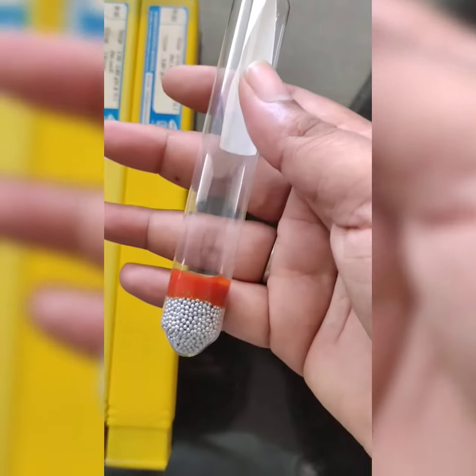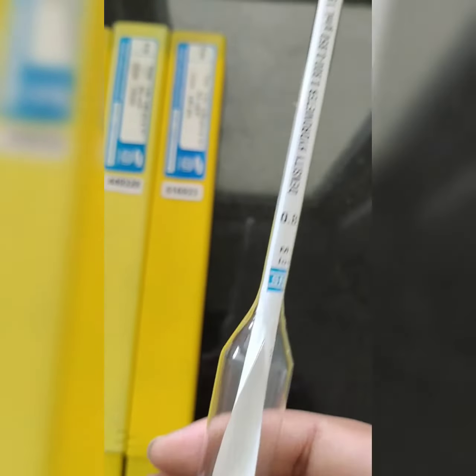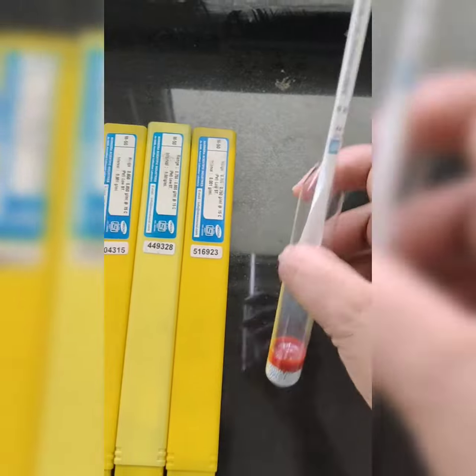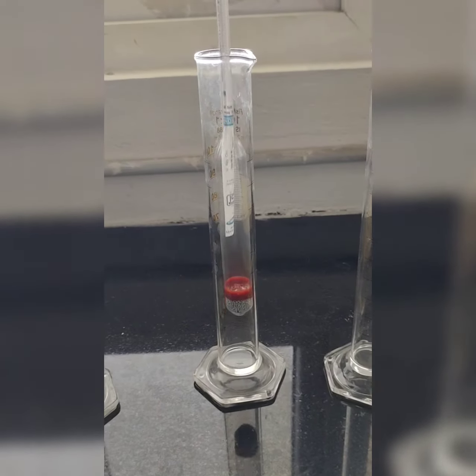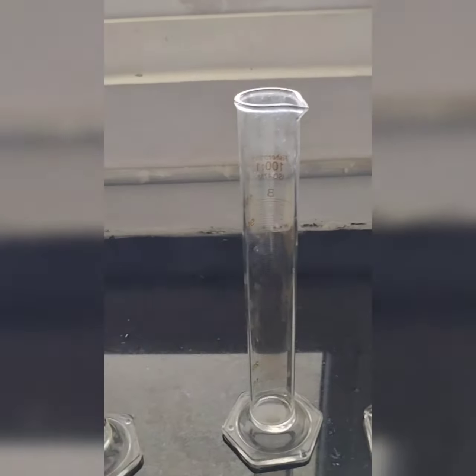Okay, so in the complete structure, at the bottom you will be seeing the lead balls. This is the complete cylinder. This is how it will look. We will dip it inside like this, so it will float. How it will happen, I will show you now.